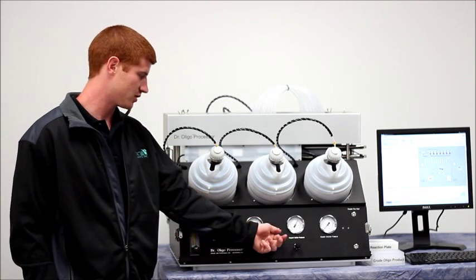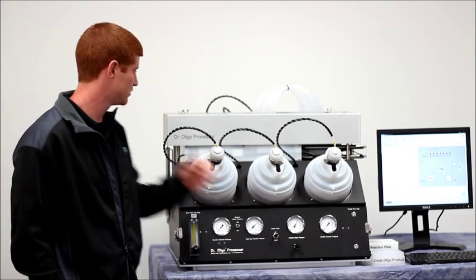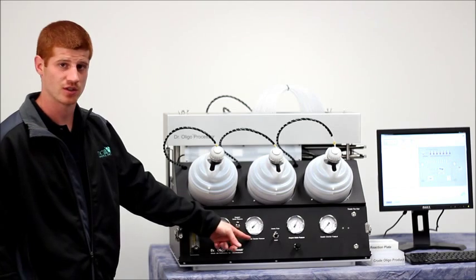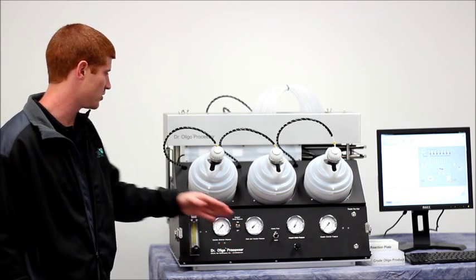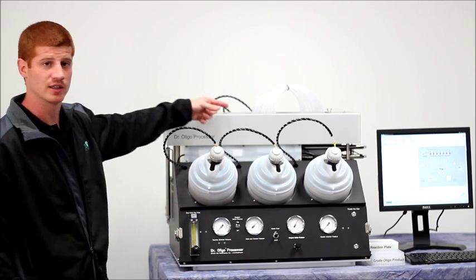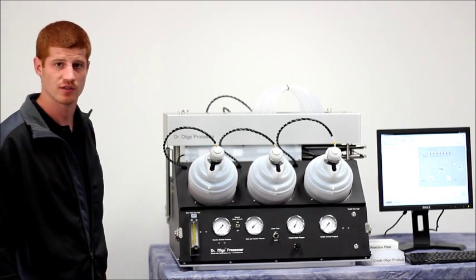This switch controls the nozzle plate up and down, which is here. The drain and transfer pressure regulator monitors the drain and transfer pressure on the instrument and is adjustable by a regulator on the back rear side of the instrument.